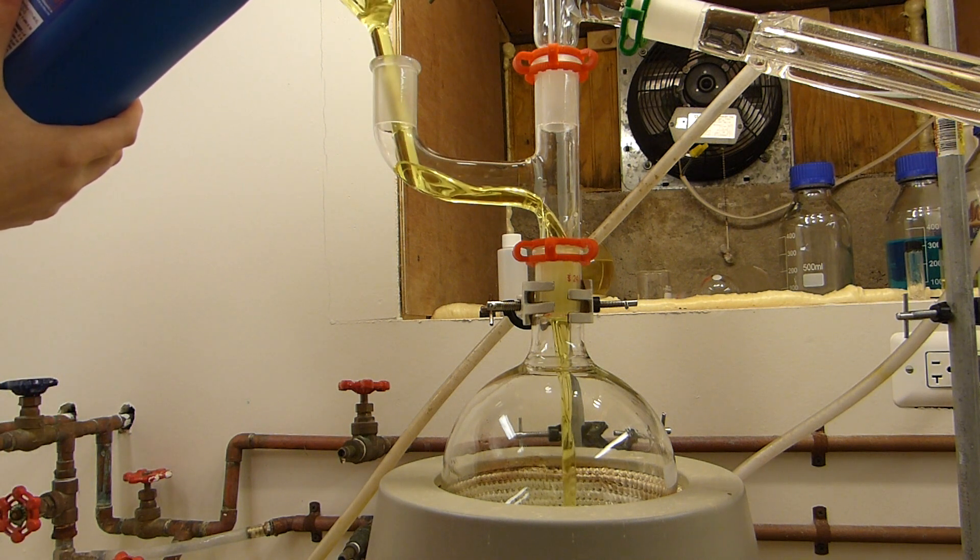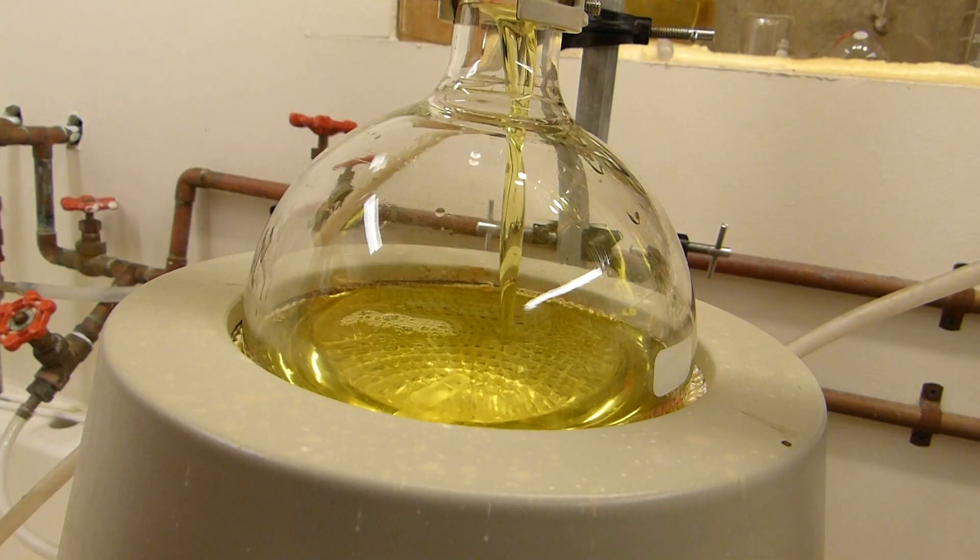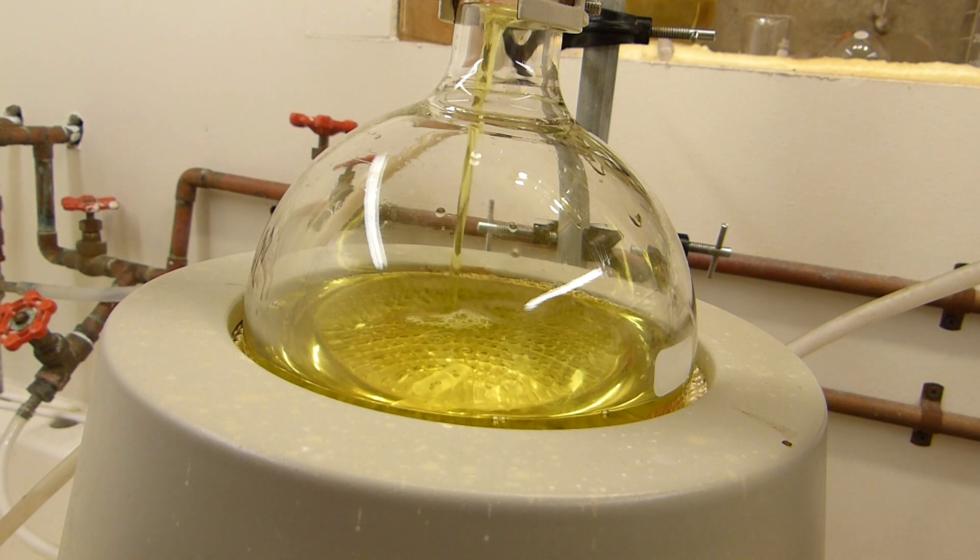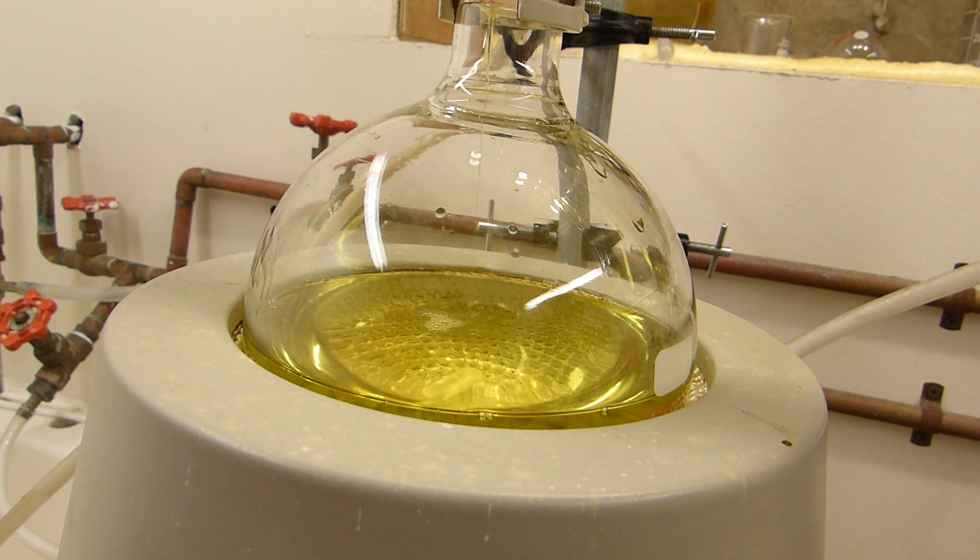You can see here that the mixture has been dyed, and we're going to remove that dye as well. I'm only going to fill the flask just under three-quarters of the way up because I don't want this to foam up and potentially boil into the condenser.